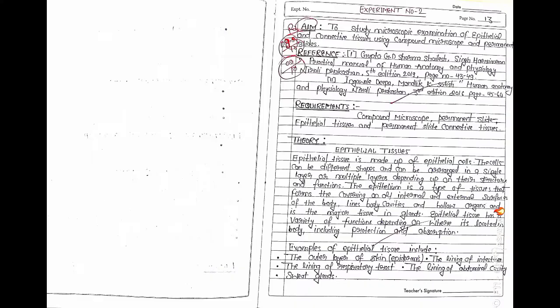First of all we see the aim. The aim is to study microscopic examination of epithelial tissue and connective tissue using compound microscope and permanent slides. After that we see the reference, which indicates where this practical is found.